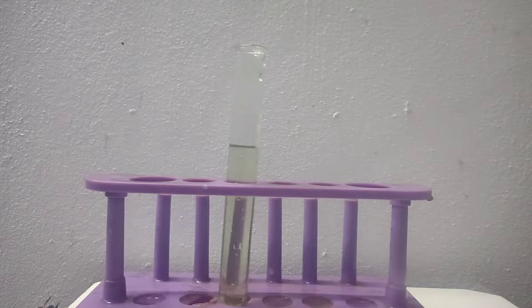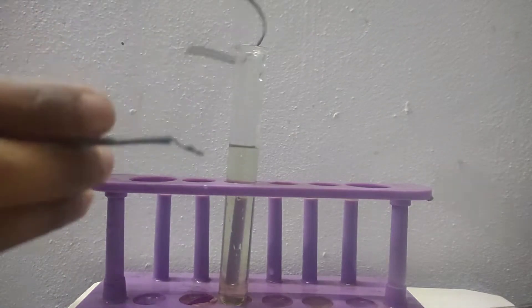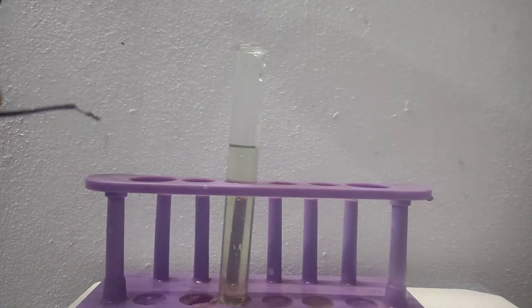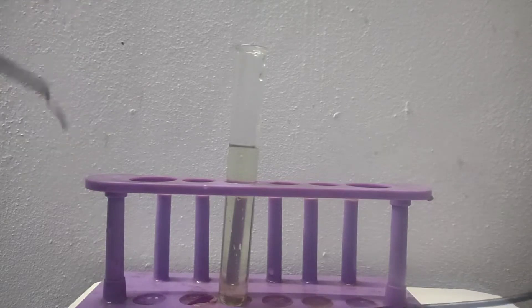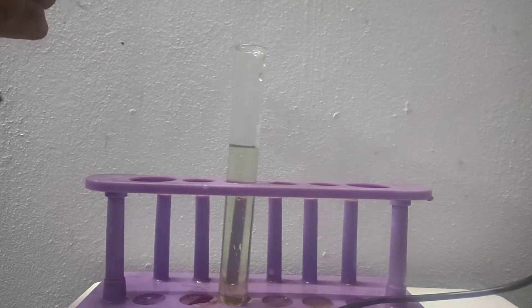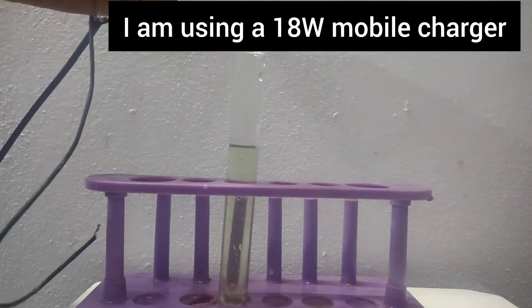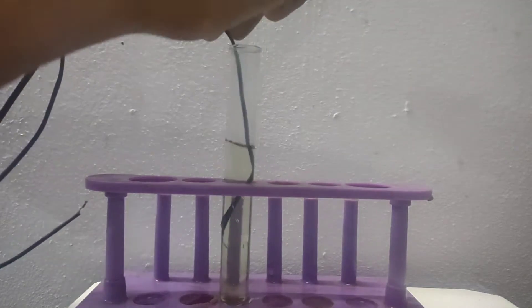The preparation is similar to how we made iron powder from an iron nail. We have to take two wires — one wire should be connected to the negative terminal of a battery or an AC to DC adapter. That negative terminal will be the cathode and it should be dipped at the bottom.